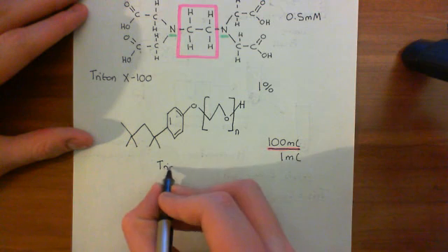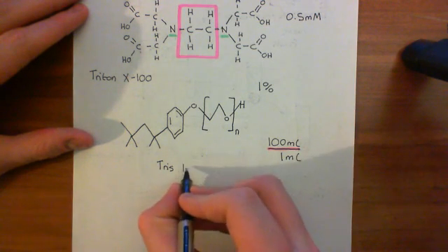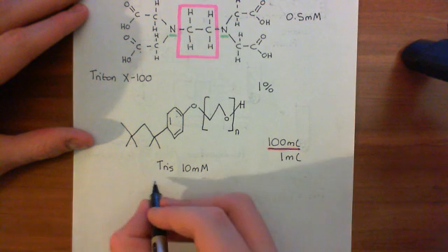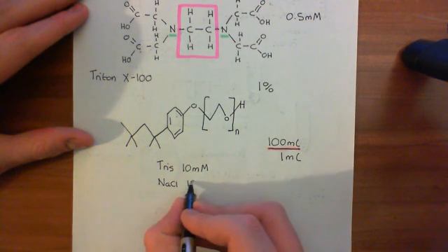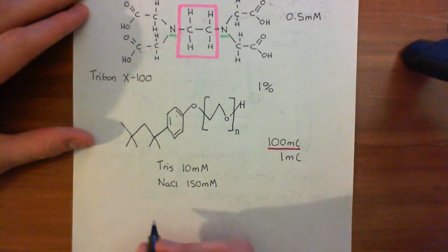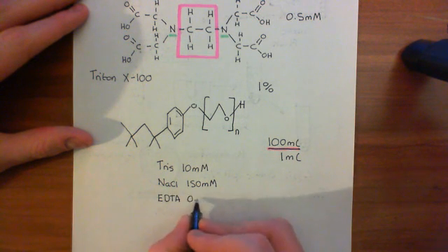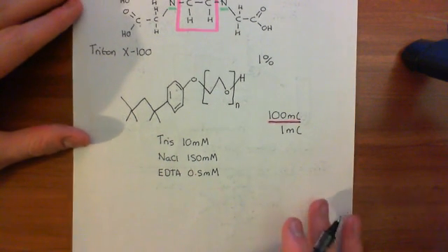Let me remind you of the correct concentrations for each of these. Tris, which is Tris-hydroxymethyl-aminomethane, we want 10 millimolar of Tris in our final 100 milliliters of lysis buffer. Next up, sodium chloride — we want 150 millimolar sodium chloride in our final lysis buffer. And finally, EDTA — we want 0.5 millimolar concentration of EDTA in our final lysis buffer.